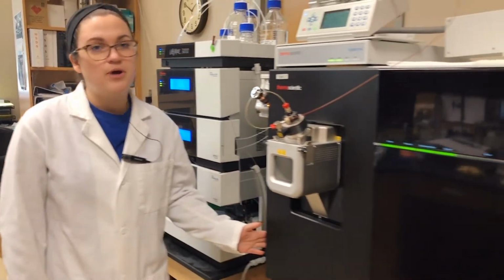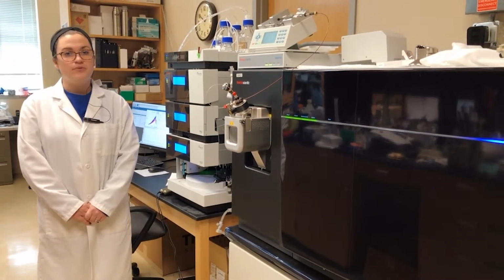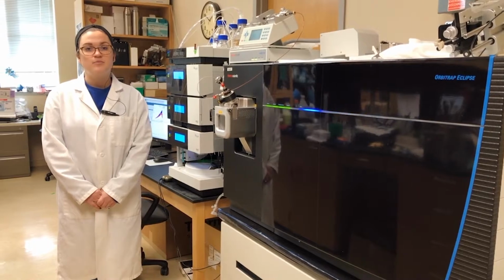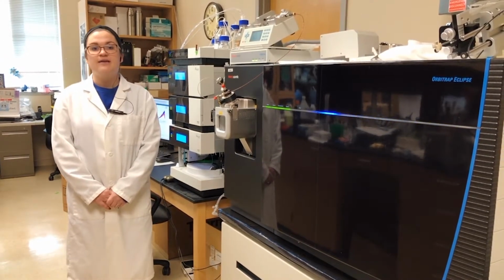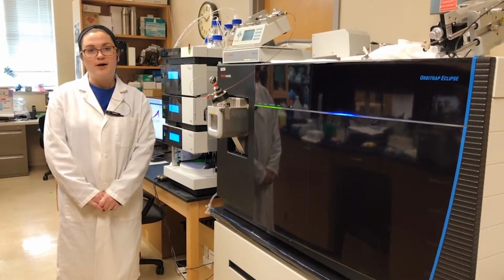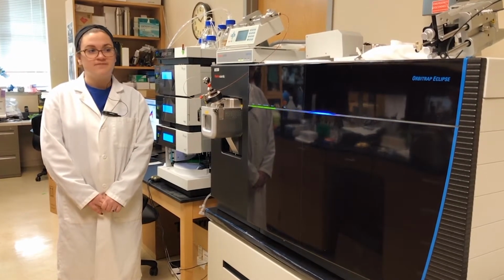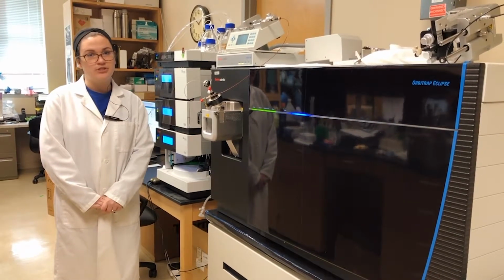This is coupled to our Thermo Fisher Orbitrap Eclipse tribrid mass spectrometer. This is the newest in the tribrid series, and it has faster scan times, higher resolution, and higher sensitivity than the previous models. With this increase in sensitivity, we're able to get informative information from just 0.1 micrograms of a glycopolymer sample. We can also get an accurate mass for a sample up to 4 decimal places, thanks to the fact that this is a Fourier transform mass spectrometer and it has extremely high resolution.